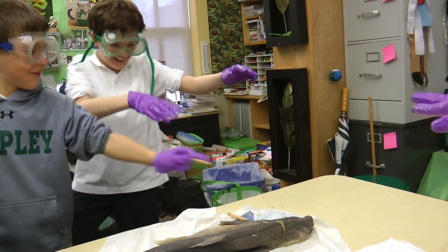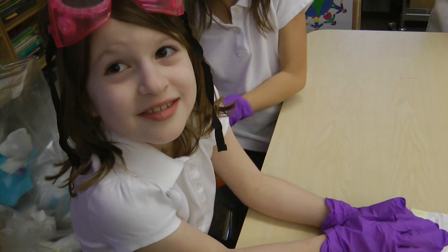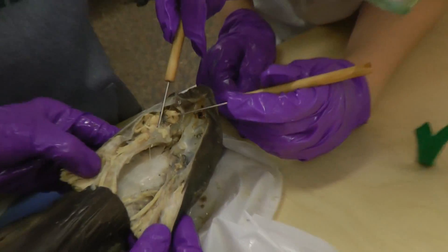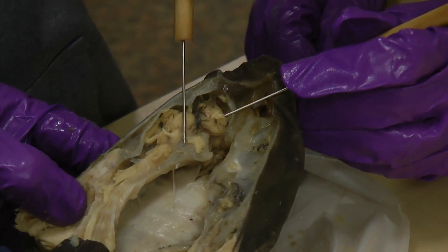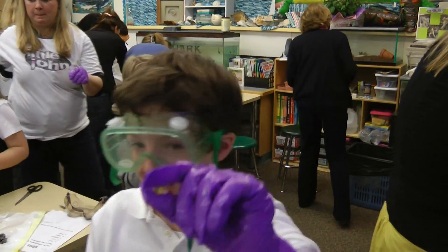Ew! There's no juice from the eye! That's gross. It's smelly as much as the video. This is awesome. They're poking at his brain. What's that? It's a shark eyeball.